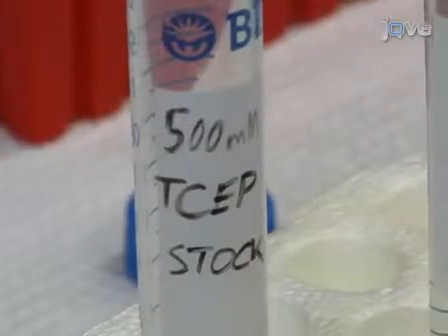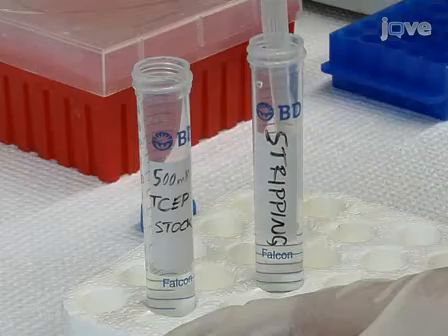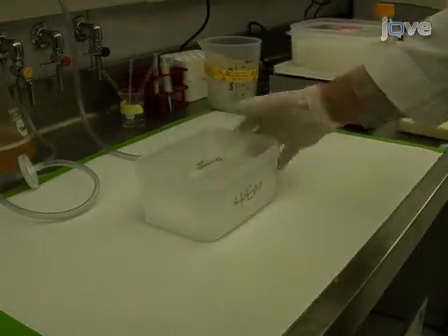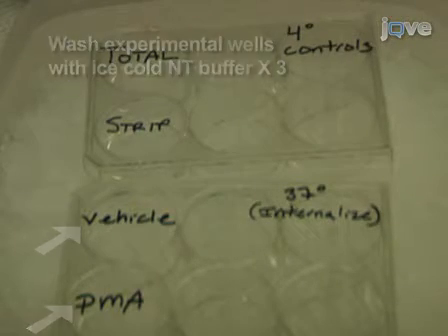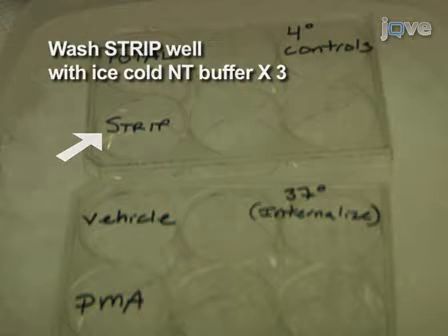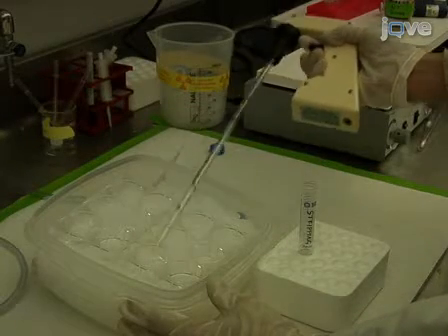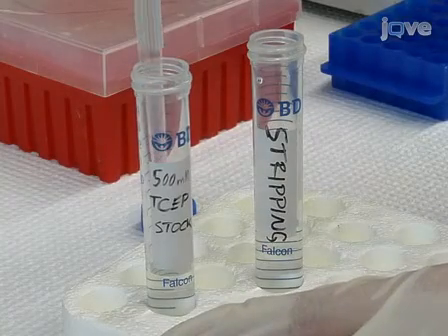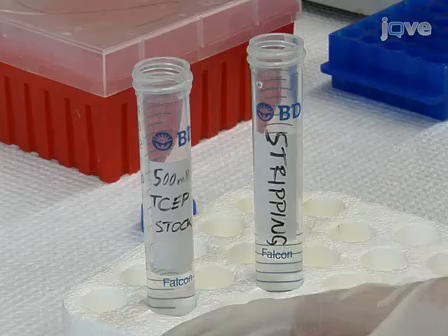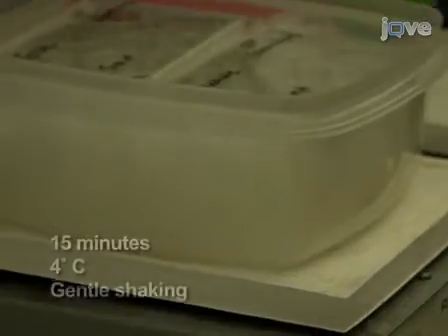Transfer the cells to a 37 degrees Celsius incubator for 10 minutes. Immediately prior to the end of the incubation, prepare fresh stripping solution using 50 millimolar TCEP in NT buffer, store on ice, and prepare a sufficient amount for 1 milliliter per well. Following the 10-minute incubation, quickly transfer the experimental plate to an ice bath and return to the cold room. Rapidly wash the experimental wells three times with 2 milliliters of ice-cold NT buffer to stop endocytosis, then wash the stripping control well three times with NT buffer, leaving the total control wells in quench solution. Add 1 milliliter of stripping solution to each experimental and strip control well and incubate on ice for 15 minutes at 4 degrees Celsius with gentle shaking. After 15 minutes, replace with fresh stripping solution and incubate an additional 15 minutes at 4 degrees Celsius with gentle shaking.